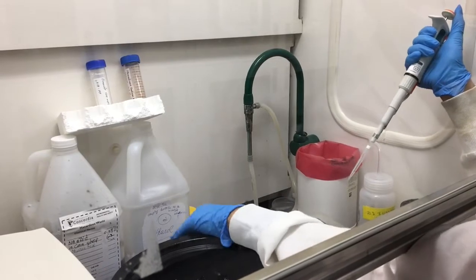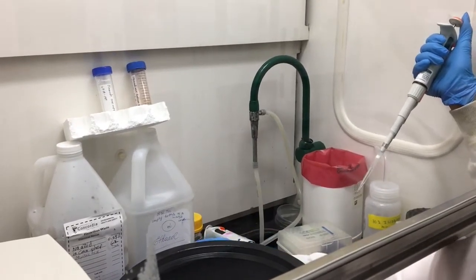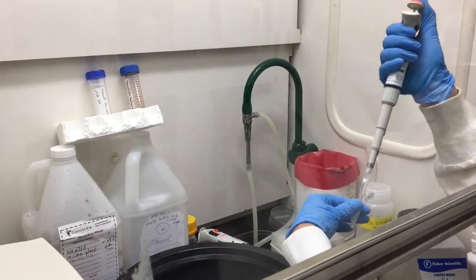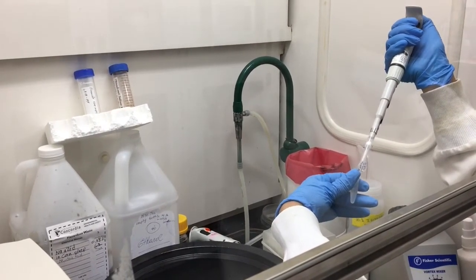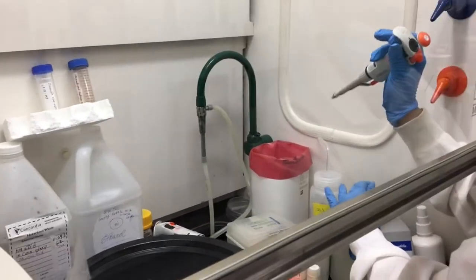This is similar to the procedure you previously used to isolate RNA from E. coli, but there are some differences. First, we resuspend the cell pellet in RNA lysis buffer. This is done for both cells grown in glucose and cells grown in galactose.